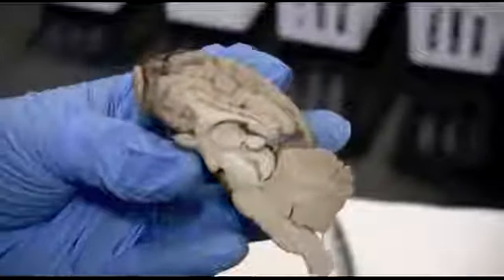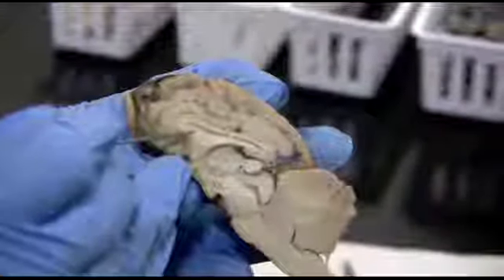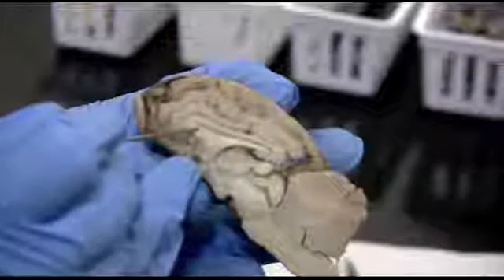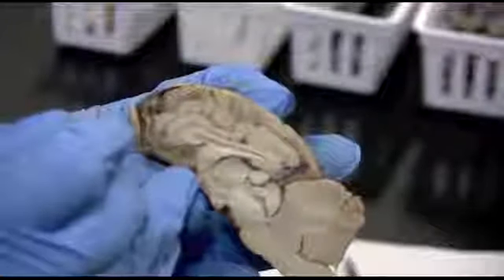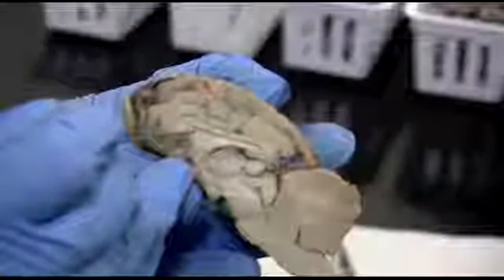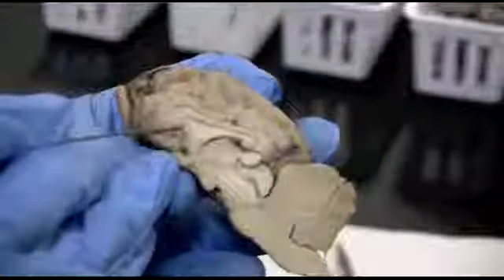And this membrane right here, very thin membrane that's covering this hole, is actually the partition between the two lateral ventricles, the left and the right lateral ventricle. It's the septum pellucidum, and there's little holes in there, the interventricular foramen, that actually allow the cerebral spinal fluid in the ventricles to pass through. I'm going to tear through it so you can see how thin it is. Just a little membrane.